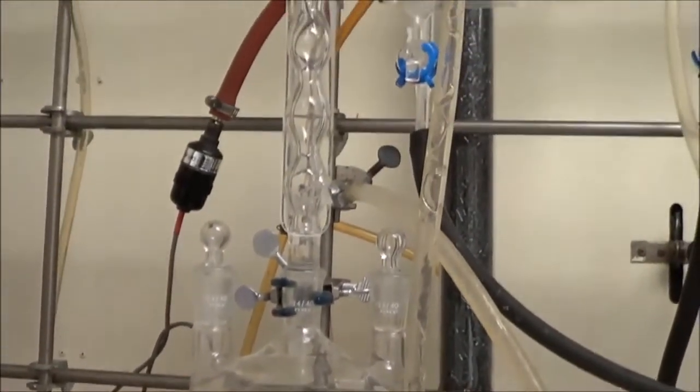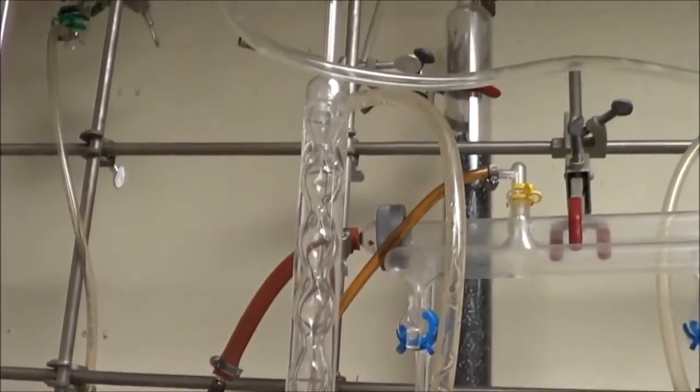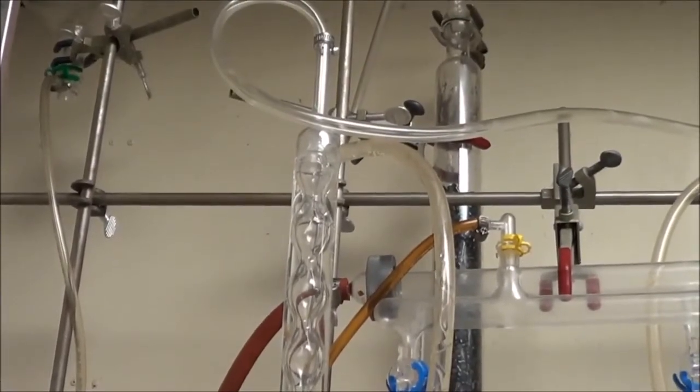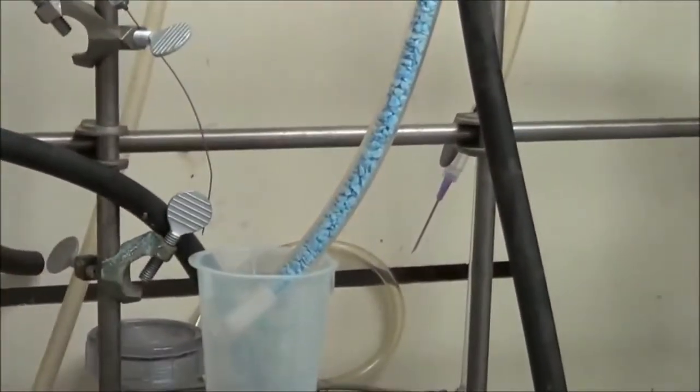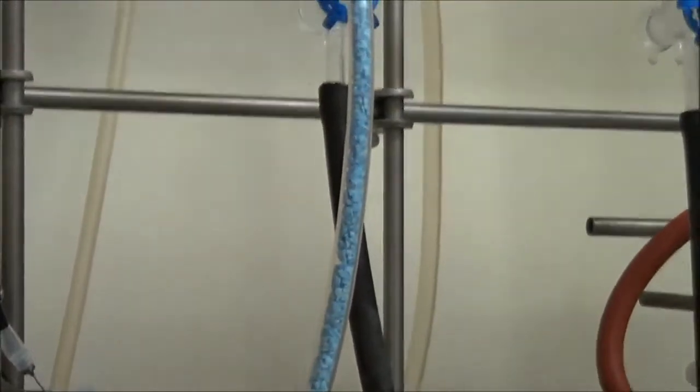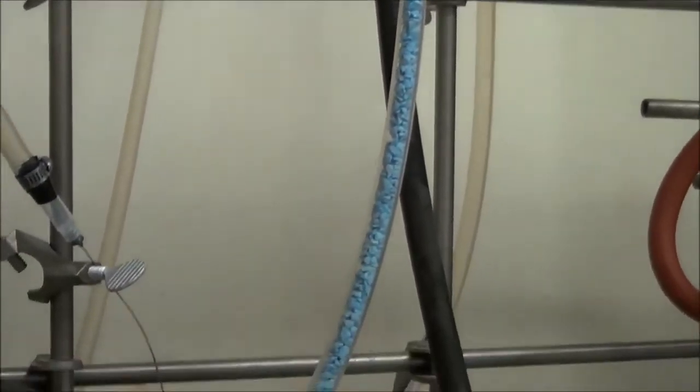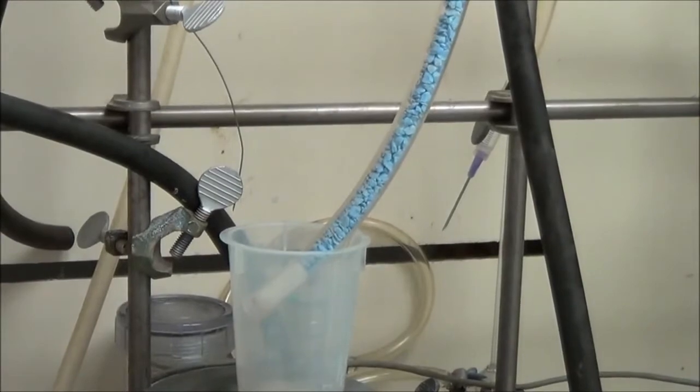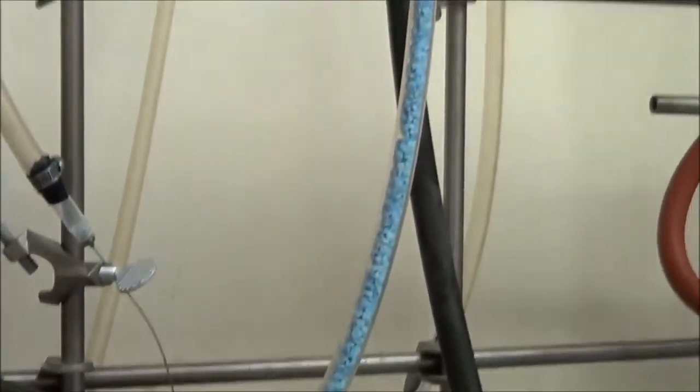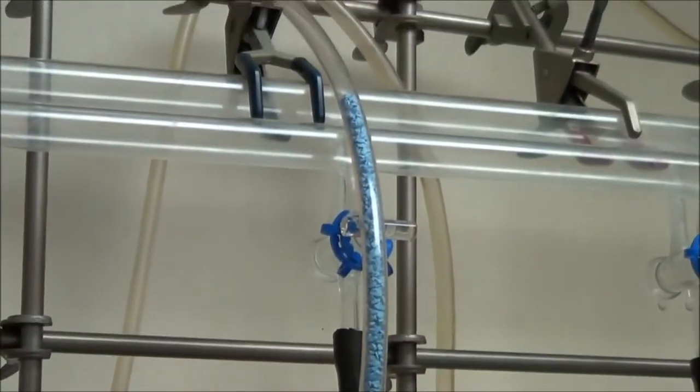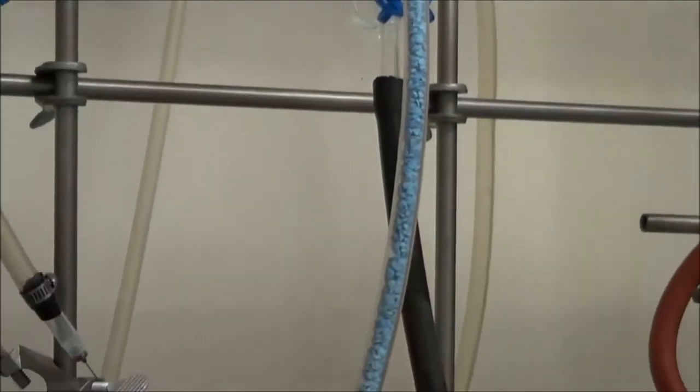The output of the condenser is connected to this drying tube. This is done to prevent HCl fumes from getting all over the hood. If you don't do this, you are going to really do a lot of damage to your hood. HCl vapors will go everywhere and just ruin anything made of metal. That and you can breathe in the vapors if you're not careful.